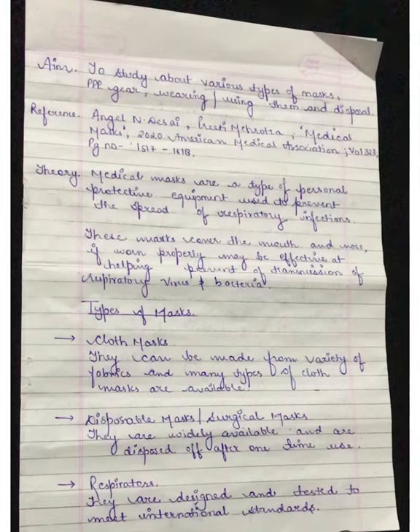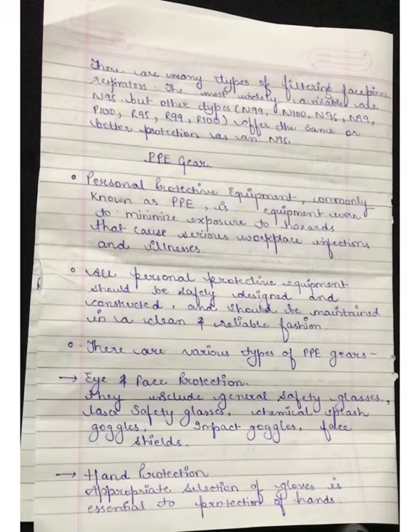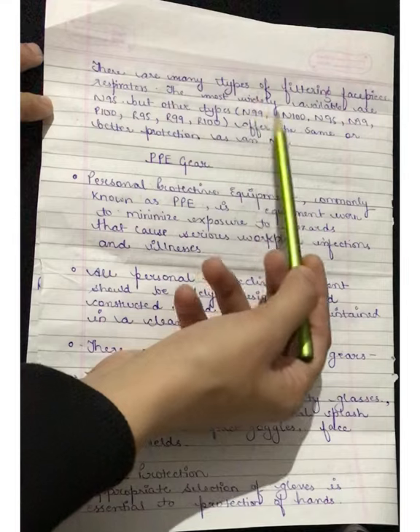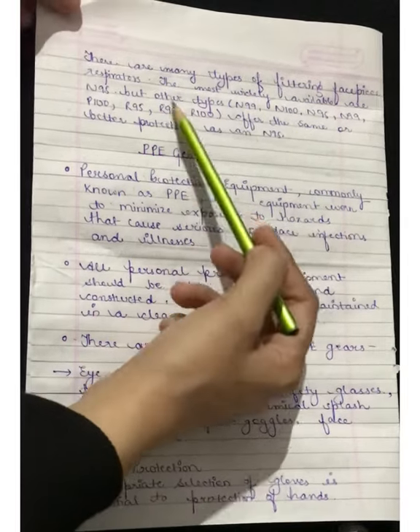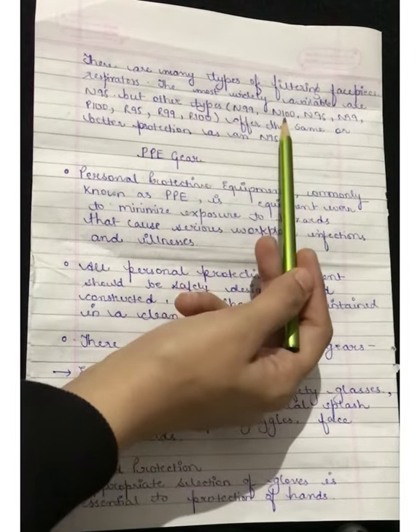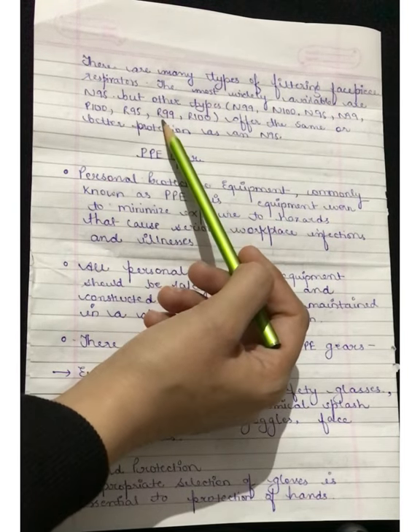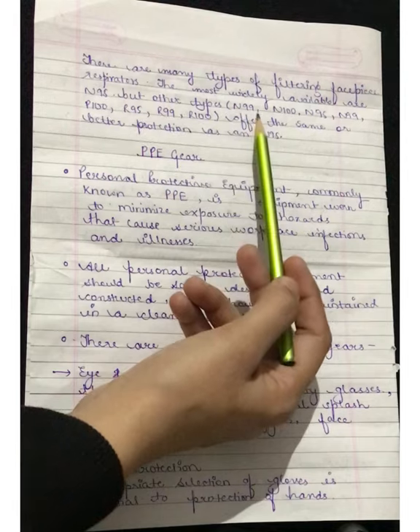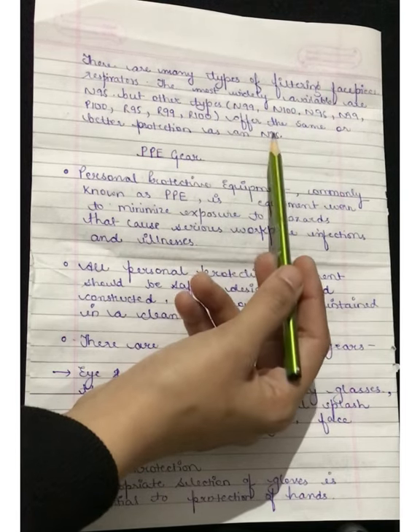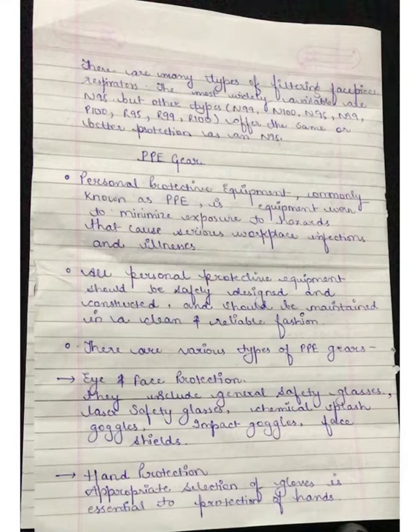Next are the respirators. They are designed and tested to meet international standards. There are many types of filtering face piece respirators. The most widely available are N95, but other types include N99, N100, P100, R95, R99, and R100. These offer the same or better protection as an N95 mask.